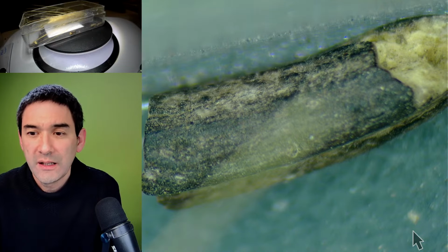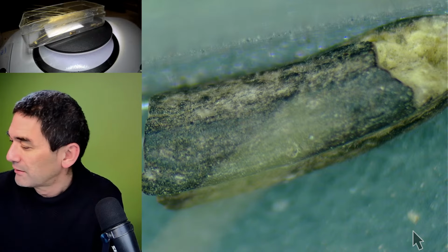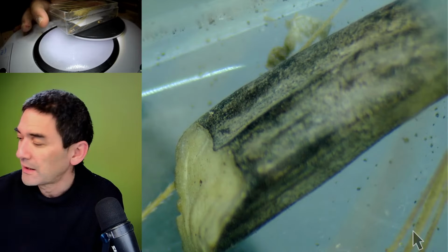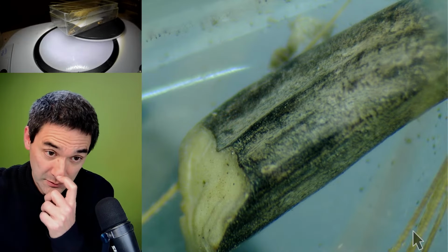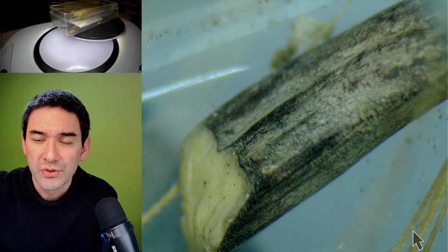Okay. Yeah. So is it like a mushroom? It is a fungus, right? So in that sense, there is of course a connection here. So here it's as well. This looks a little bit like one of those grain kernels, but it's not. And they're significantly larger than those.